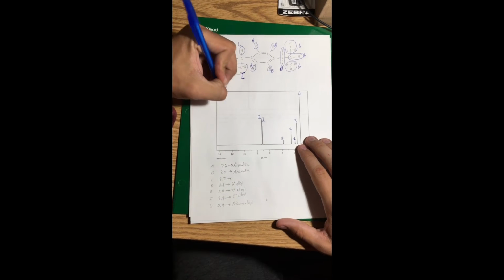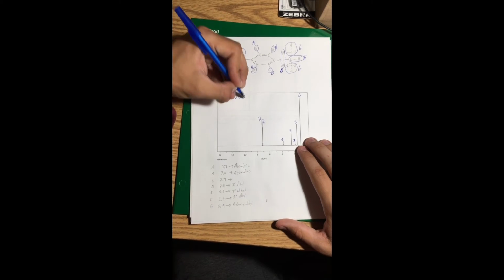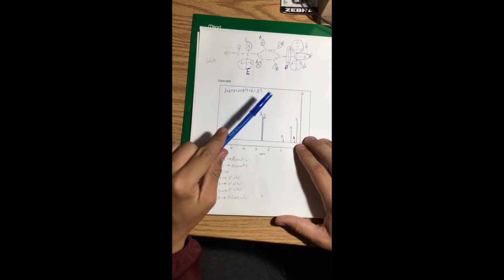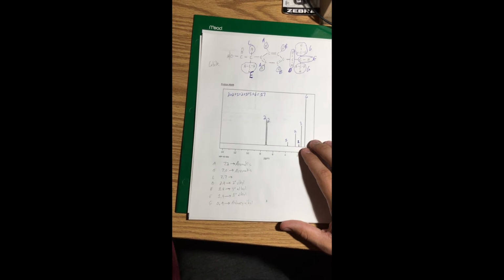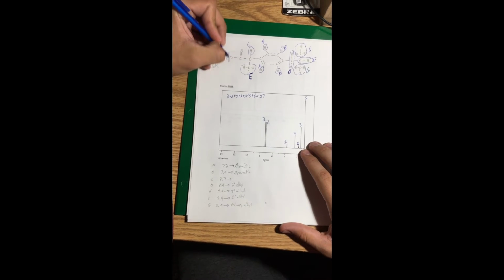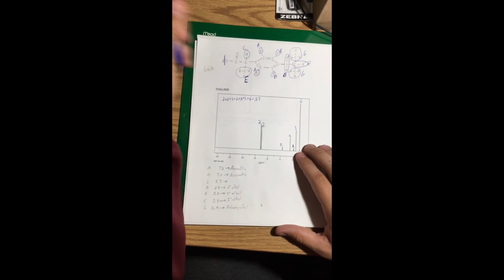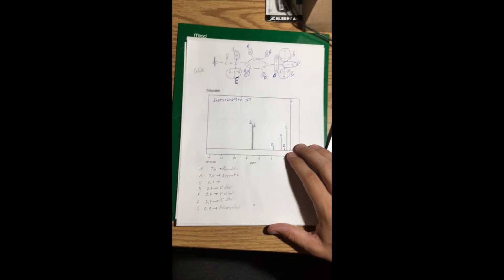Now if we add these up, it's actually equal to 17. And you might be wondering why we're 1 short. Well, actually on this alcohol group over here, this hydrogen actually gets cut off, called labile. It gets cut off because it's broken down when the molecule is subject to the NMR testing. So then you're stuck at 17.